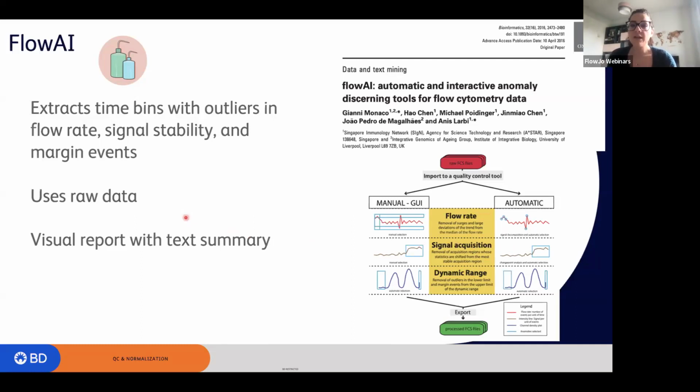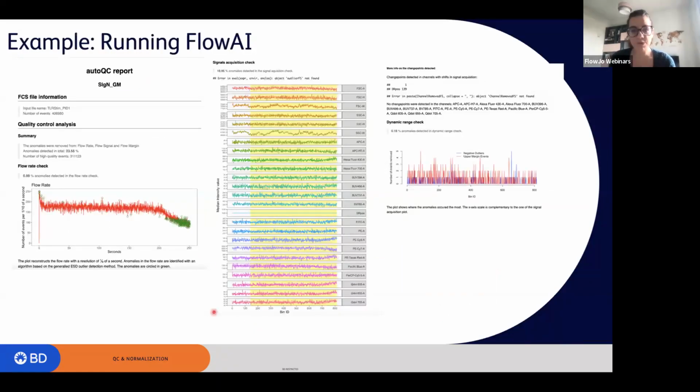Also, this algorithm uses raw data. This means that when you export your files from the instrument, you want to run either FlowAI or FlowClean right away on that file. It creates a really nice report with a text summary. What you will see is an auto QC report where you have all the information on the file: the file name and the number of events, and then a summary of what happened during these checks. It gives you the percentage of events that were removed, about 23.55%, and the number of high quality events that were given back.